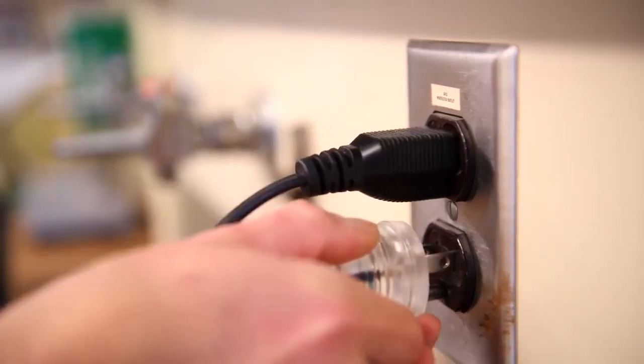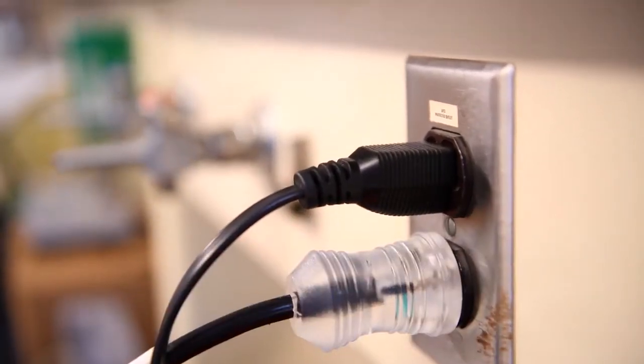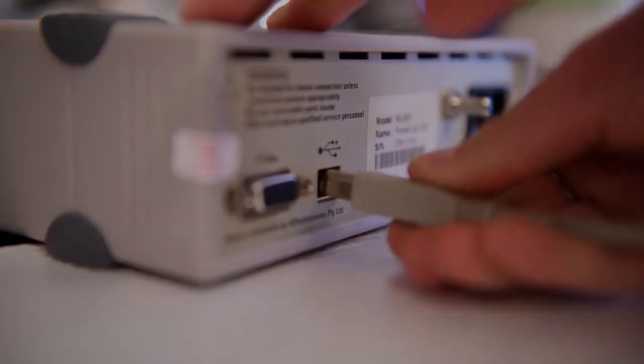Plug the power cord of the power lab data logger into a power supply and connect the data logger to a PC computer using the USB cable connector.